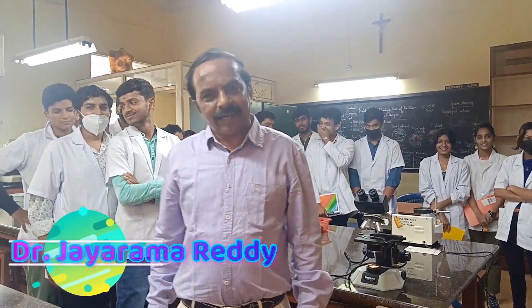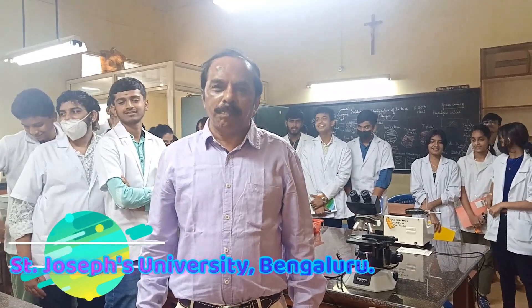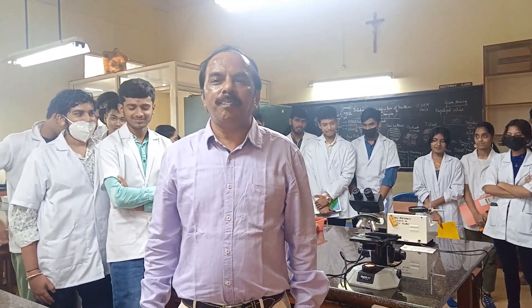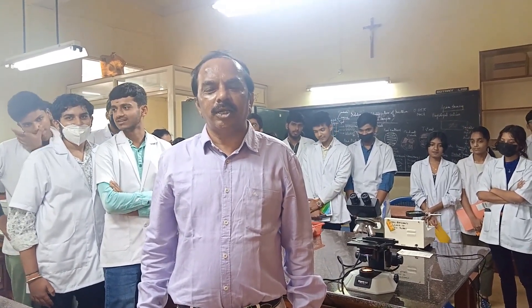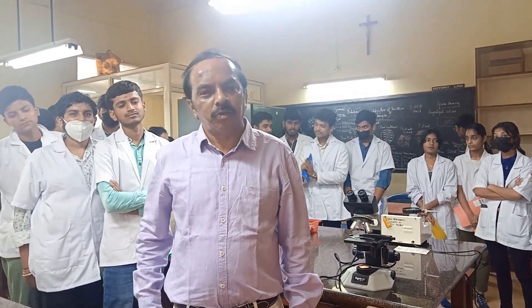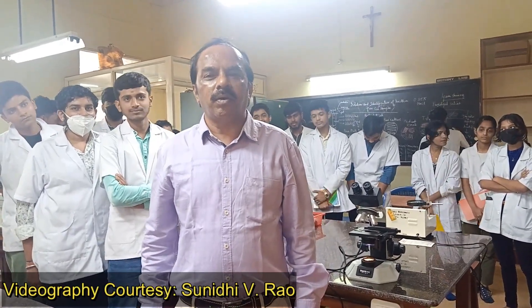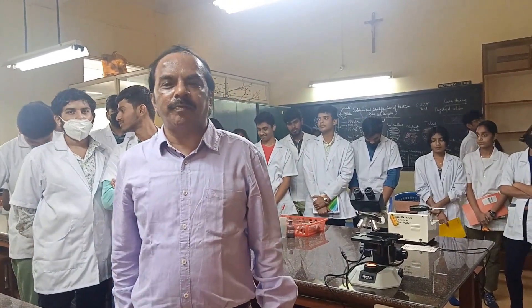In this video I will show you the different equipment and items used in microbiology — right from the petri dishes and the media we prepare for culturing, to the microbial cultures, the incubator, the laminar airflow, the autoclave, and the inoculation loop. All the instruments and items normally used in a microbiology lab for culturing microbes will be shown in this video.